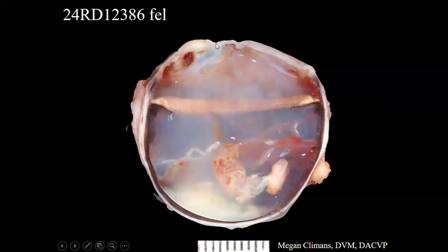So we do have this kind of thickened and cloudy cornea, and in particular, there was this area of notable thickening and opacity right here. So we'll take a look at that histologically in particular. The globe is basically full of this viscous, cloudy fluid, just more viscous throughout all the chambers than you would expect, and probably too liquidy in the vitreous and too thick in the anterior chamber, essentially. And then little bits of blood here and there.